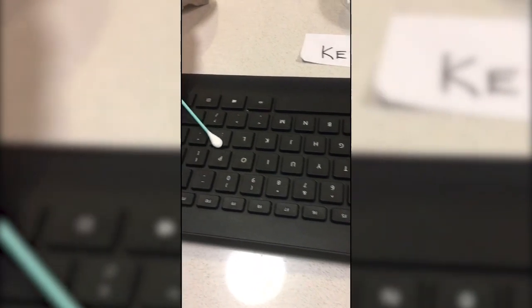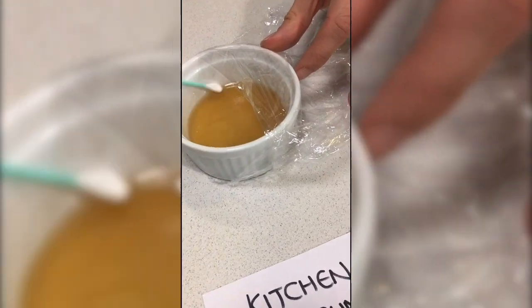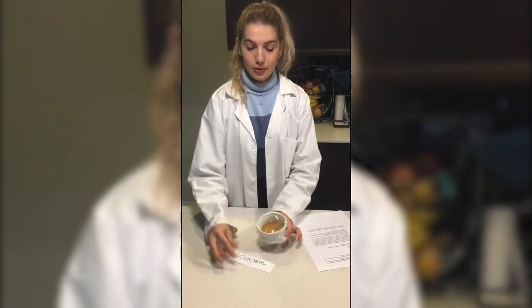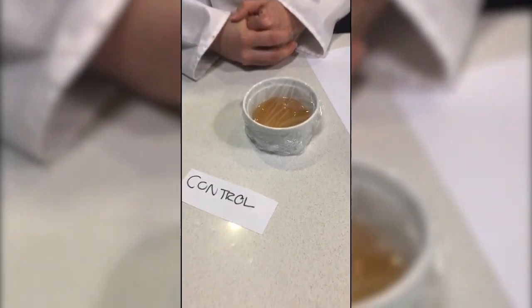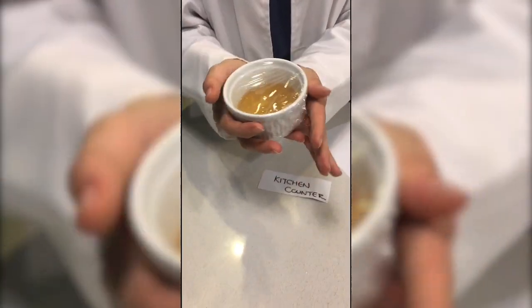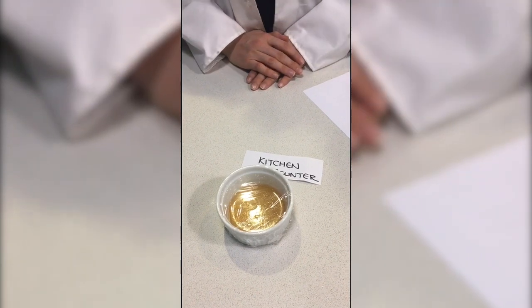Use a separate cotton bud for each location. Next, I'm going to test the keyboard. Lastly, I'm going to check my kitchen counter to see where bacteria is growing. In science, we use controls to make sure experiments are working. If your control plate has nothing growing on it, then your experiment has worked. If not, you'll have to improve your sterile technique. Make sure to cover your plates after transferring your bacteria and keep them in a warm area, approximately 35 to 37 degrees — in the oven or a warm spot behind the fridge — leave them overnight or for two days and check to see what grows.